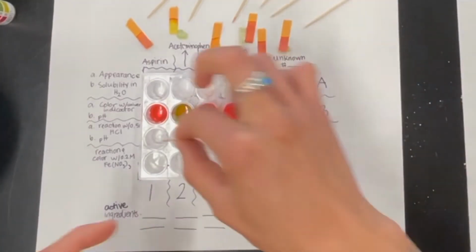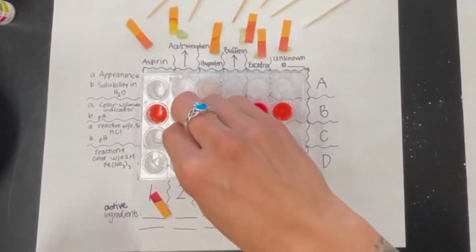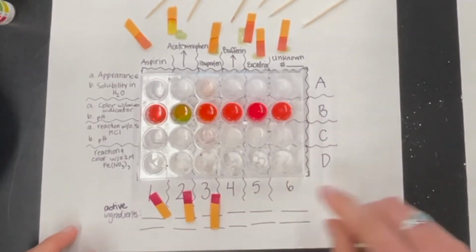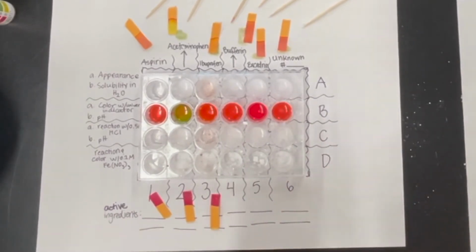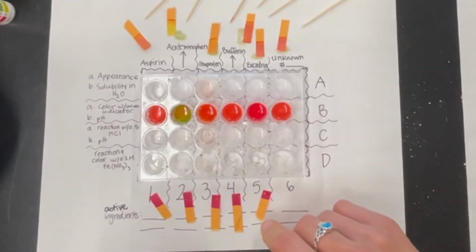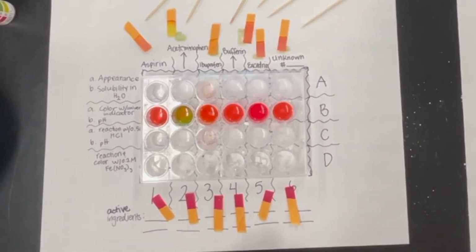Okay, so I'm going to put these pH test strips down here. Wow, look at that dark color. I mean, it's not a surprise because our hydrochloric acid is a very strong acid. Our stomach acid is extremely corrosive, so I'm not surprised that these are a nice dark red color. We'll look at our indicator strips in just a second to see what that actually means in terms of its pH, but I can tell you right now, at least these are looking really acidic.